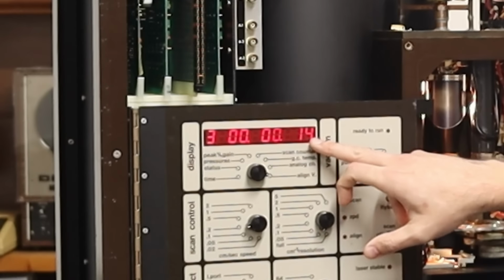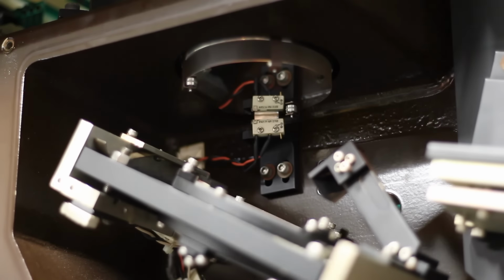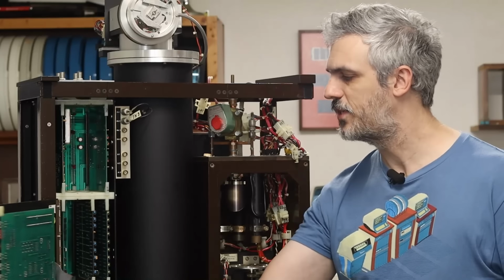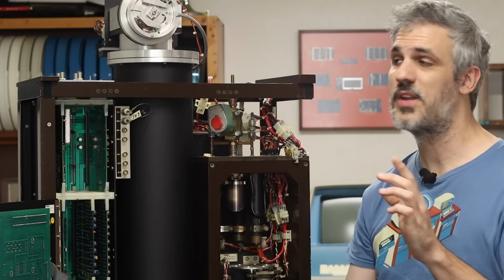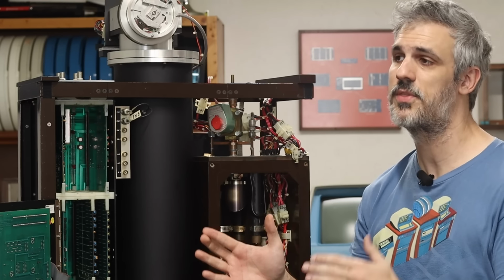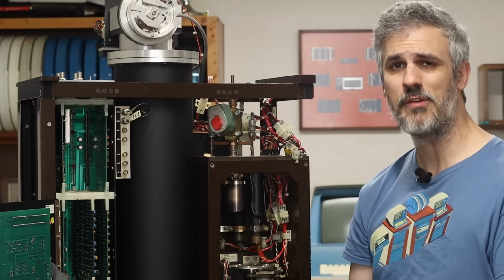And we can see that it was bouncing between like 10 and 18 or whatever. So it's sending a signal to this motor to tell it to move, but the motor is not moving. So maybe that signal isn't actually making it to the motor, which brings us to a potential problem somewhere here in the computer. Now it's important to remember that when I got this machine from Mike, it was actually a parts machine. So things had been pulled out and removed and replaced and kind of shuffled around.